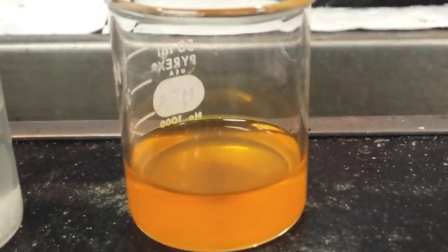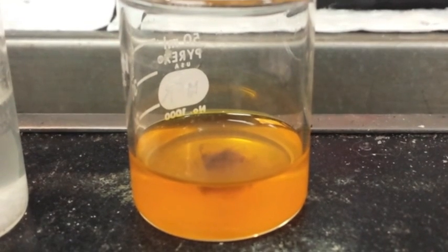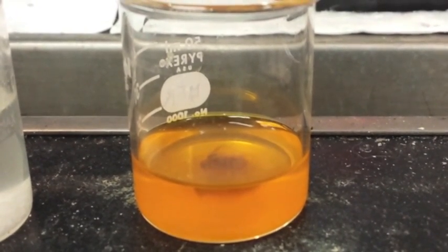Let's make sure you can see this. You see instantly the black. That is the gold dropping out of solution.